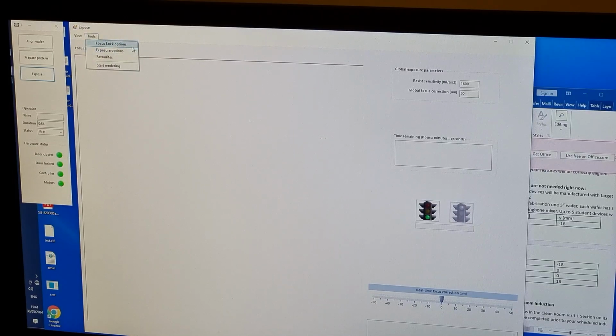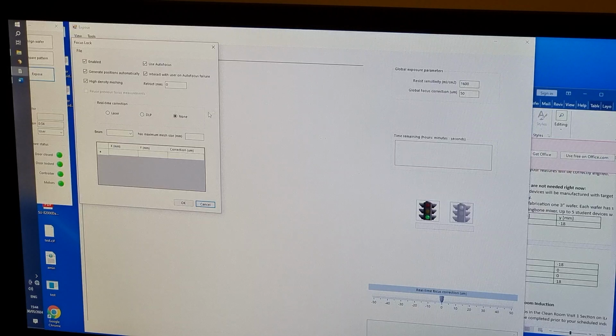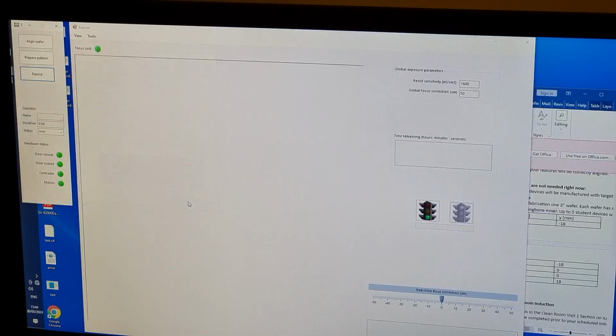Under Tools, Focus Lock Options, we usually choose None under Real-Time Correction. Unlike our first layer, our data bounding boxes do not exceed the wafer area, so we can generate focus lock positions automatically. Start the exposure by clicking the green traffic light. As before, the machine performs an autofocus at 3 positions bounding the data. This is used to compensate for any tilt in the wafer surface.